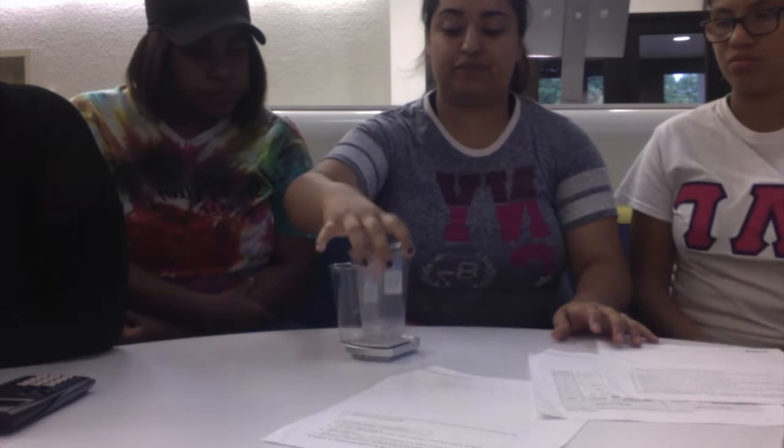And then you're going to keep doing the same thing for 4 additional readings. So you should have 5 total. And you're going to do the same thing for cup number 2. After you get your readings, which we've got right here, you're going to find the average of your readings, and then you're going to perform a deviation from average equation. And then that will be the end of activity 1.